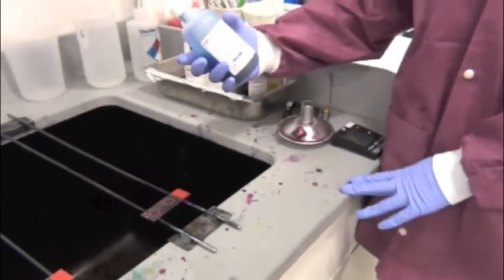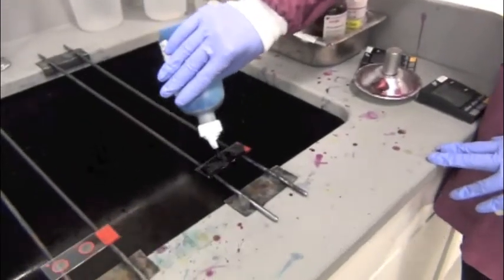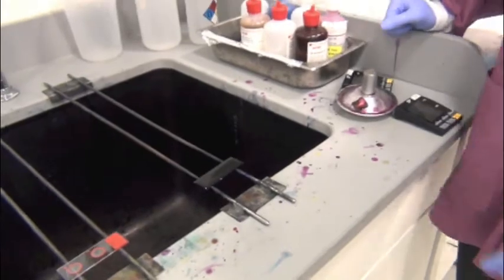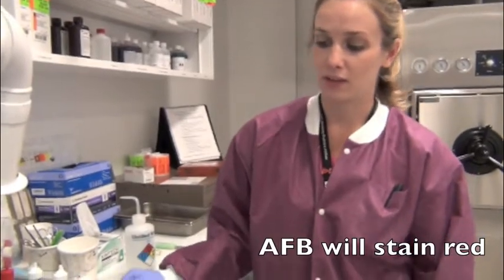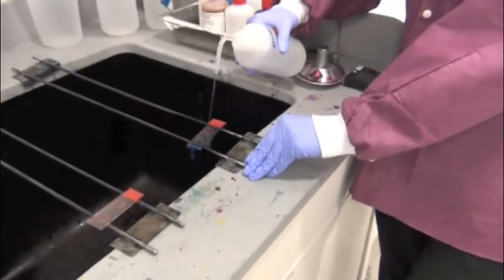After you've rinsed, we add our counterstain, which is methylene blue. Any bacteria or fungal elements or yeast in the specimen will turn blue, whereas our acid-fast bacilli will still stain red. So if you see any blue background, it could be a contaminant or it could just be specimen. And once again, that stays on for 2 minutes. Rinse the methylene blue off after your 2 minutes.